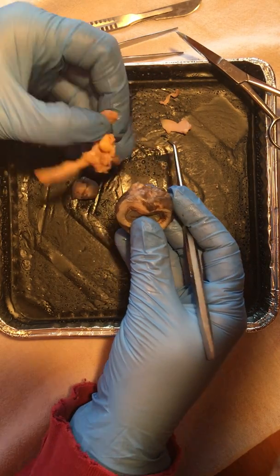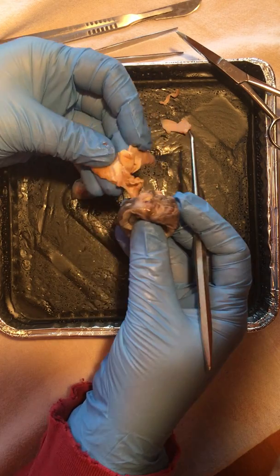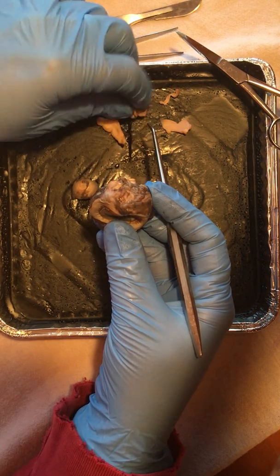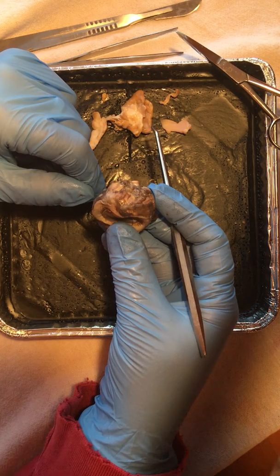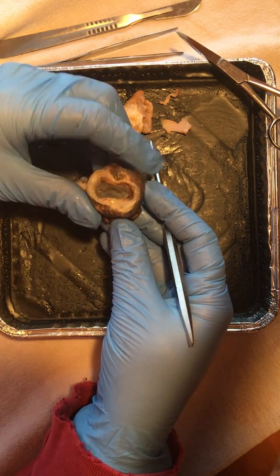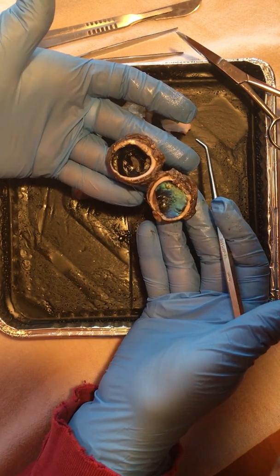I did remove a lot of the tissue on the outer ends of it. There were some muscles there, but mostly fat tissue that surrounds that particular portion of the eye. Muscle, fat, and connective tissue, again, provide a lot of nutrients and support and structure around that eye as well. And that completes the sheep dissection for A&P, North Dakota State. Thank you.